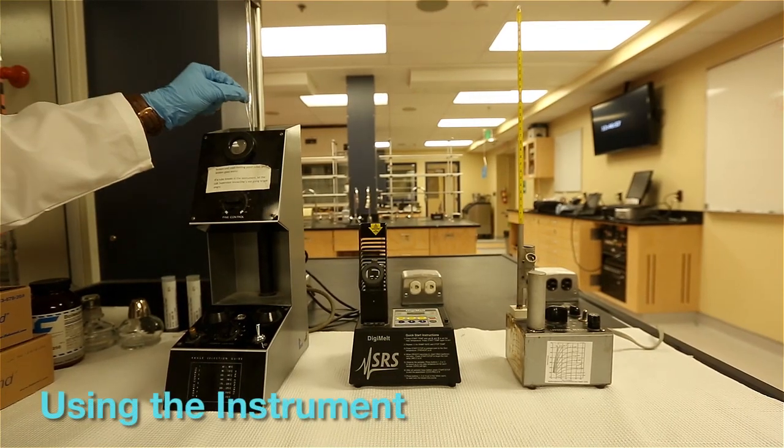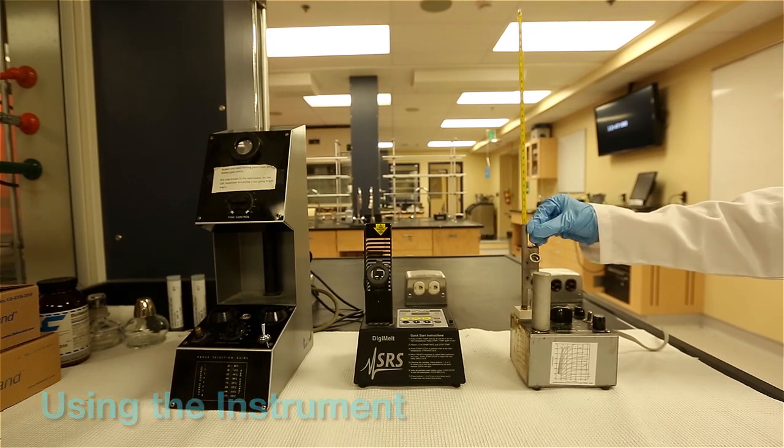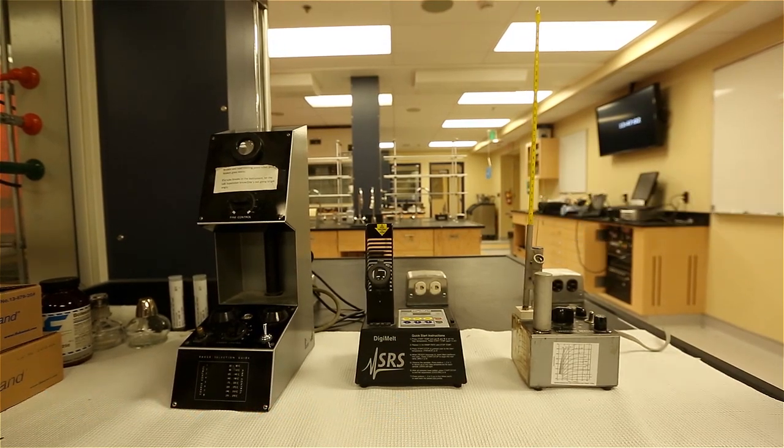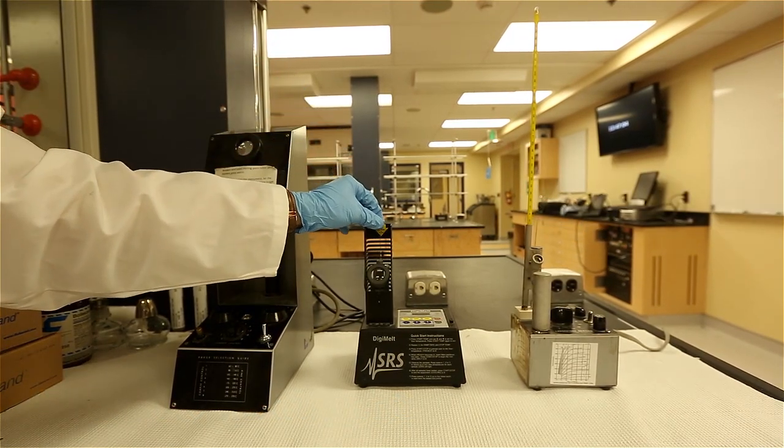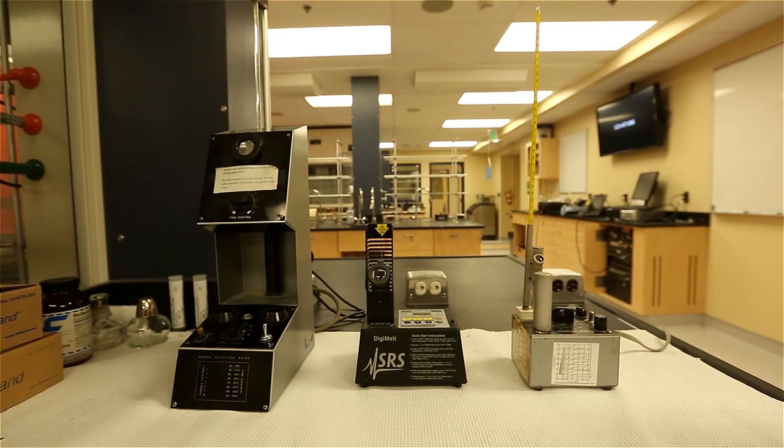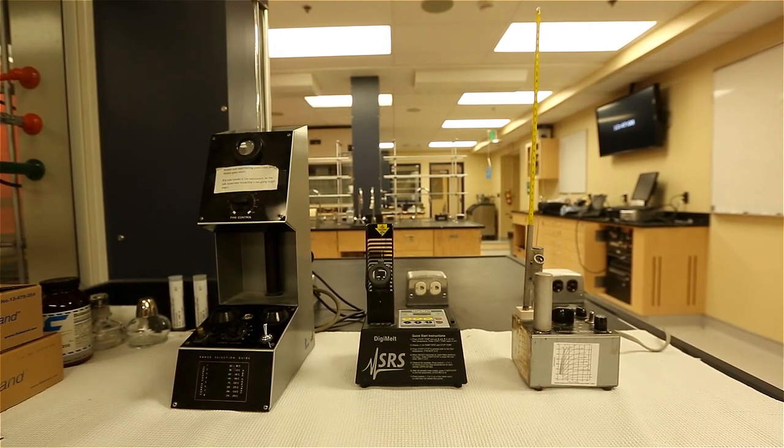Place your prepared sample into one of the three slots of the instrument. You can measure up to three samples at a time. Each instrument works by the same principles, however there are slight differences in the settings. Refer to the lab manual for specific instructions.